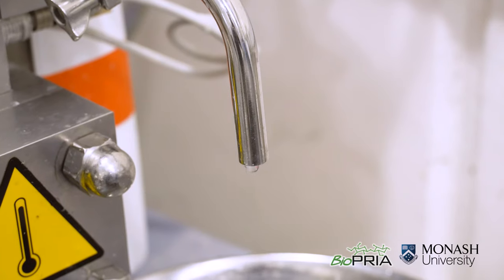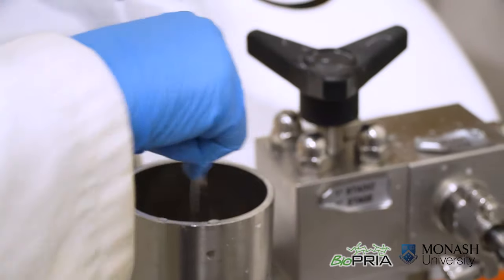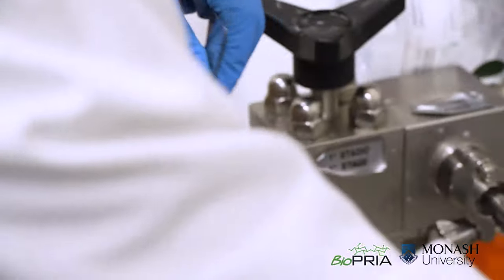In this activity we are going to investigate the effect of number of passes in the degree of fibrillation of nanocellulose. We are going to pass these gels again in the homogenizer.